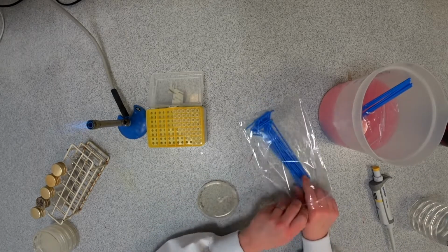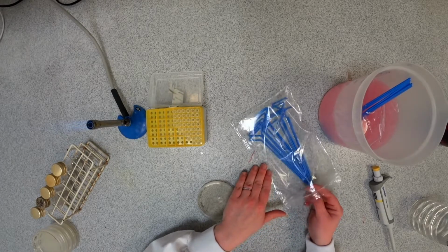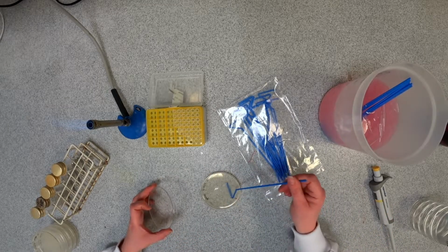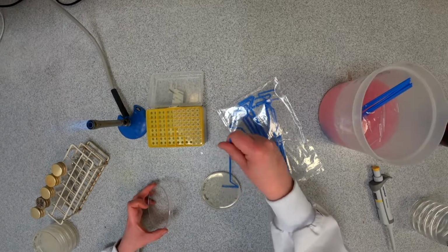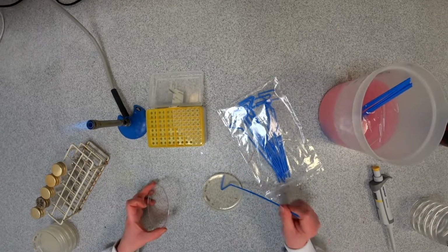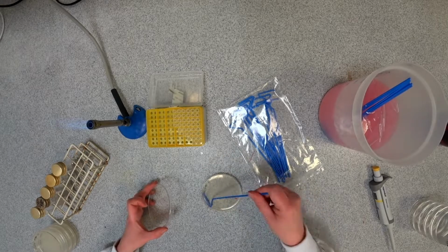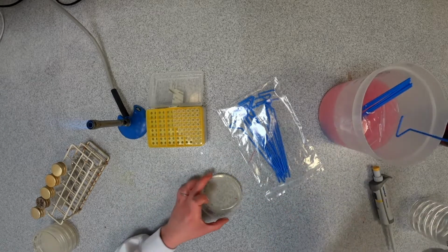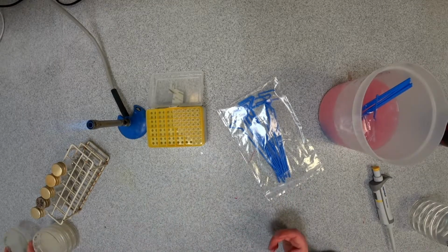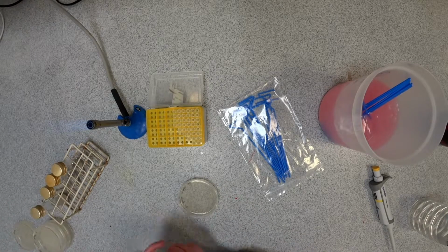Next I'm going to take a plastic spreader, so these are sterile. Pick up sticks sometimes, but there we go. One of the spreaders, and then I can use this to smear that liquid right the way across the surface of the agar, making sure I get into all of the cracks and all of the edges to spread it as effectively as I can right the way around. Spreader then goes into the waste discard for sterilisation, and that plate is then ready for incubation. So I'm just going to carry that on.